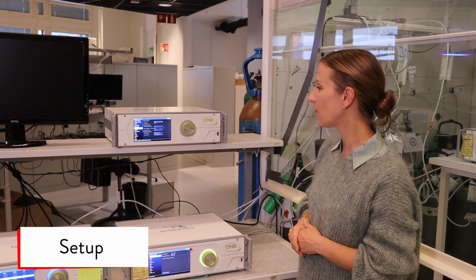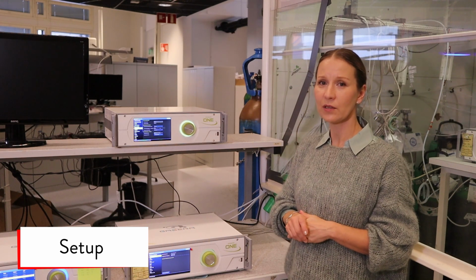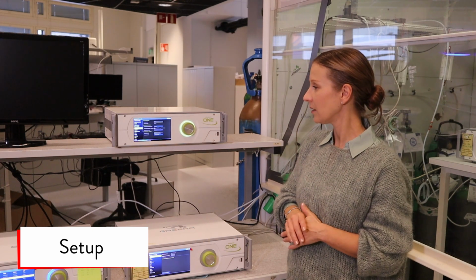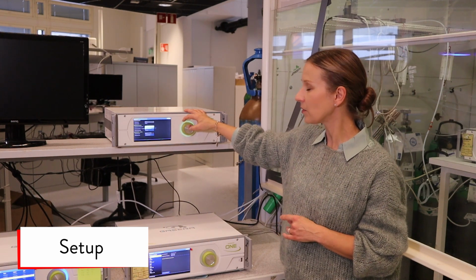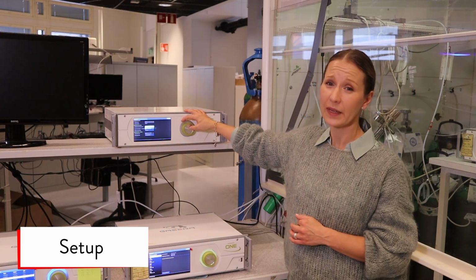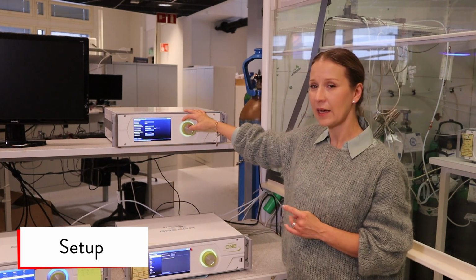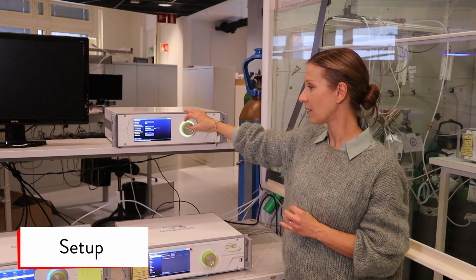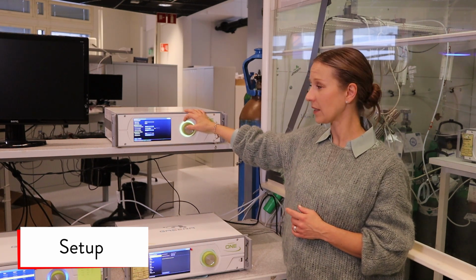In the general info, the serial number comes from the factory, but you can also name your device. And when you gather the data, the default data display mode is normal, and you can also select the moving average. The y-axis limits are either auto scale or you can select a minimum and maximum.